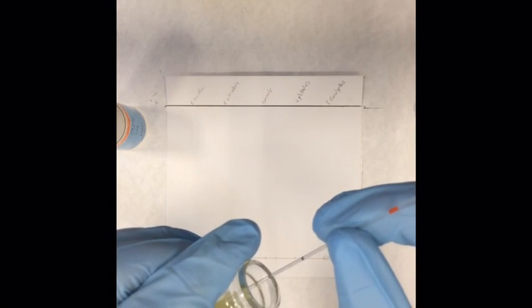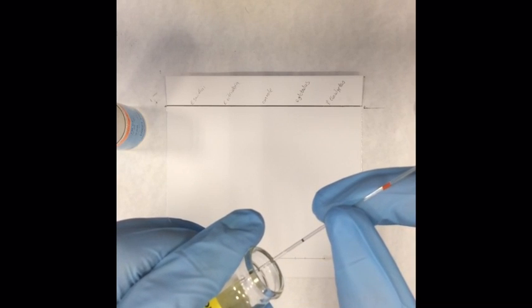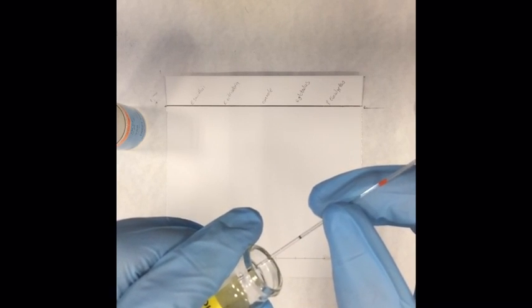Make sure the sample volume is consistent every time, as you want the same concentration of sample on each spot.